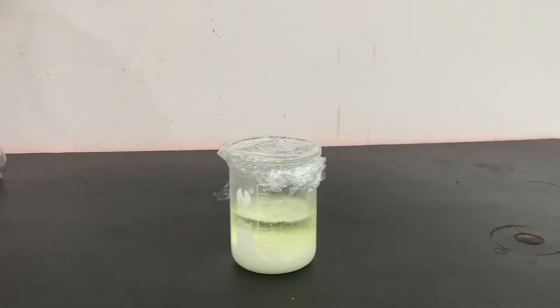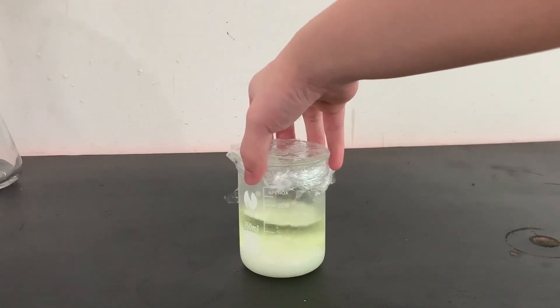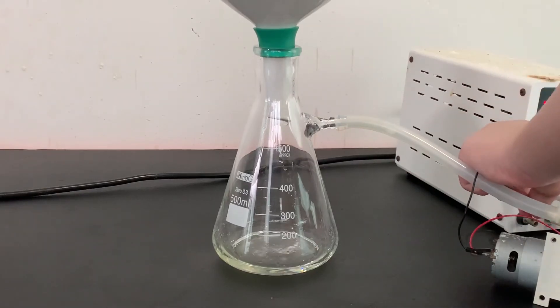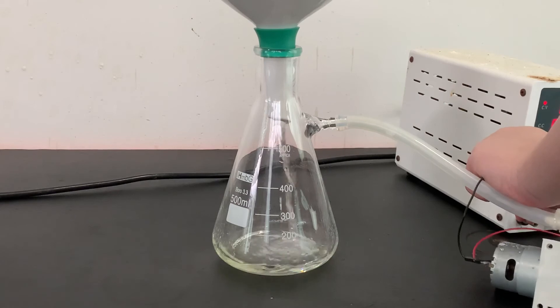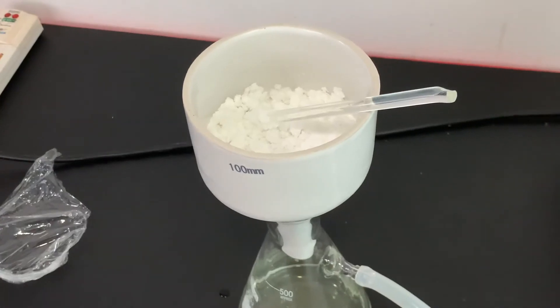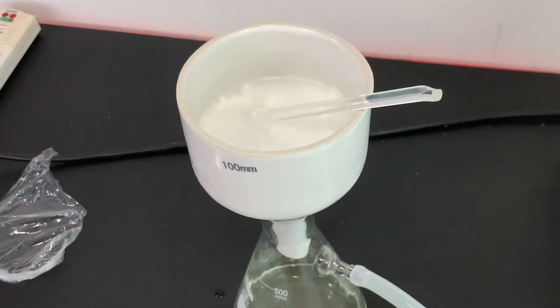After cooling, crystals of pure 3-nitrophthalic acid have formed. The crystals were again separated by vacuum filtration and washed with cold water.